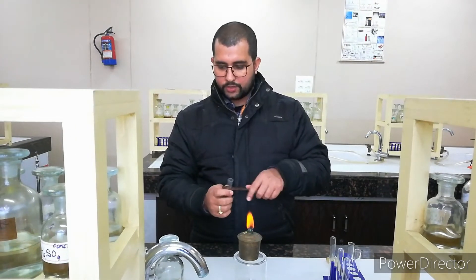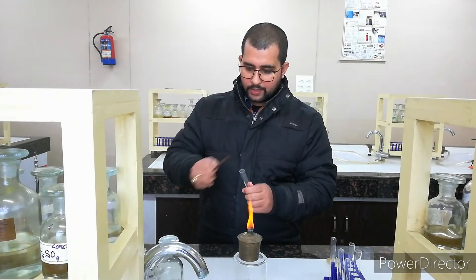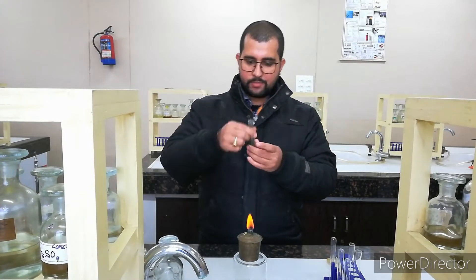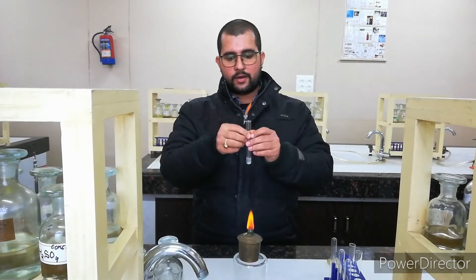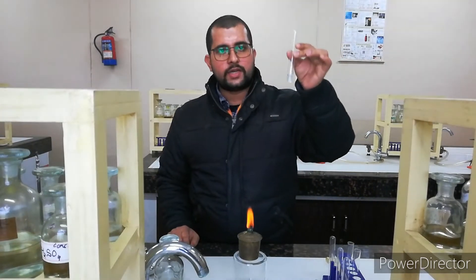We will take a very small amount of salt, make a clear transparent solution, and then add BaCl₂. This is the BaCl₂ test. If sulphate is present, after addition of BaCl₂ it will give a white precipitate immediately; otherwise the solution will remain transparent.